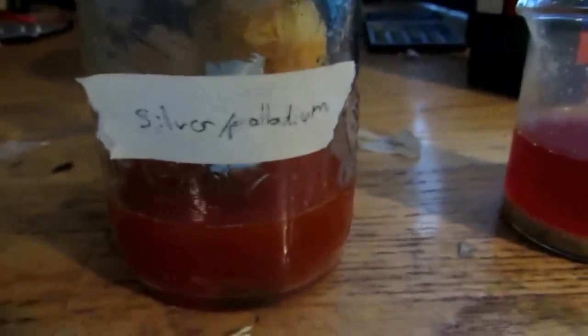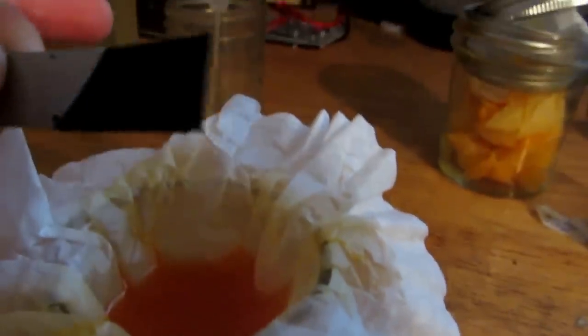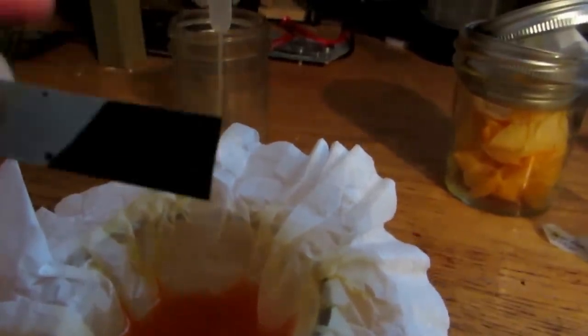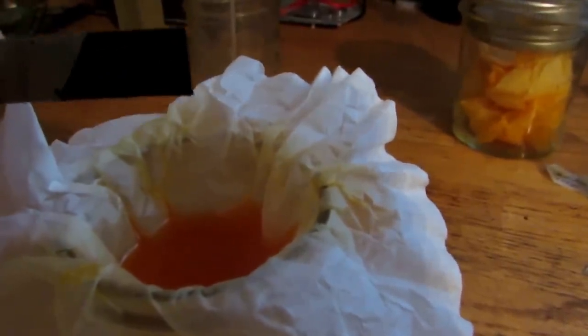So, we're simply going to drop in our things, and I'll meet you back when something happens. You can see this one was filled with hydrochloric acid, so it's definitely fizzing. And, this one is just kind of, I don't know, we'll see what happens. So, I'll be back in a bit. Okay, so here's our pure solution, and I just did this a moment ago. But, if you dip it in, you can see a very nice displacement. So, it is the next day, and I am filtering off this other solution. And, you can see it contains a whole lot of palladium because it's all displacing off. Now, it doesn't look shiny because it's in very fine particles on this zinc strip. But, once this is done filtering, I'm going to drop in the zinc strip and leave it, and it will dissolve, and the palladium will fall off. So, I'll be back when all three mixtures are done. The other two are done, but I just won't show them until this one's also done.